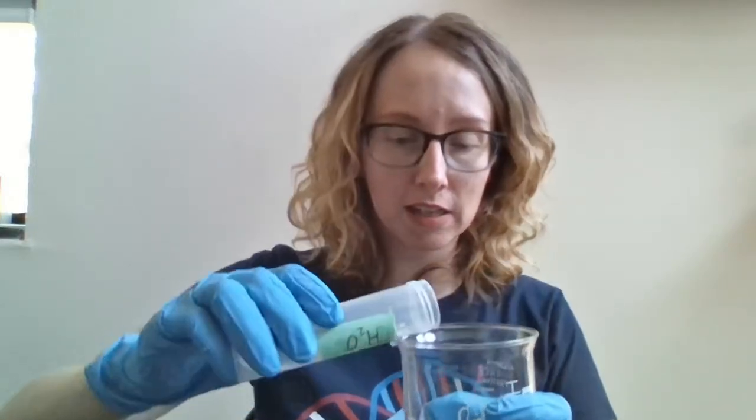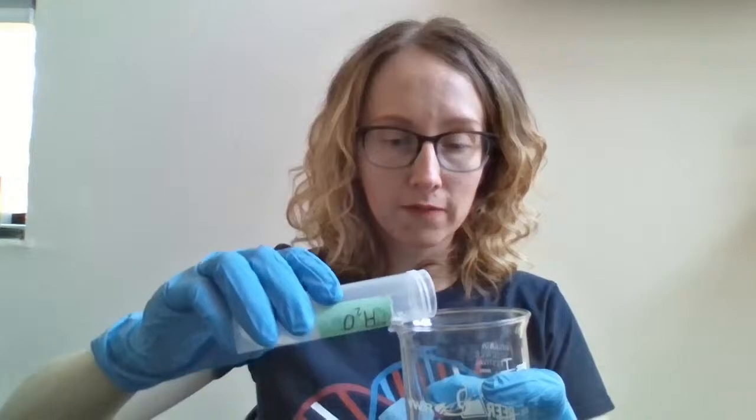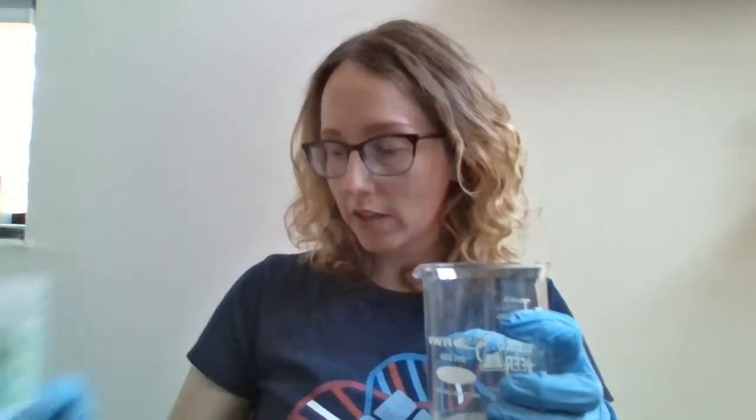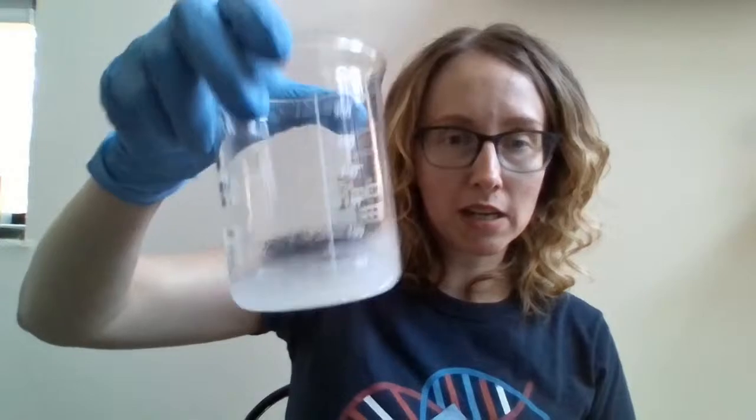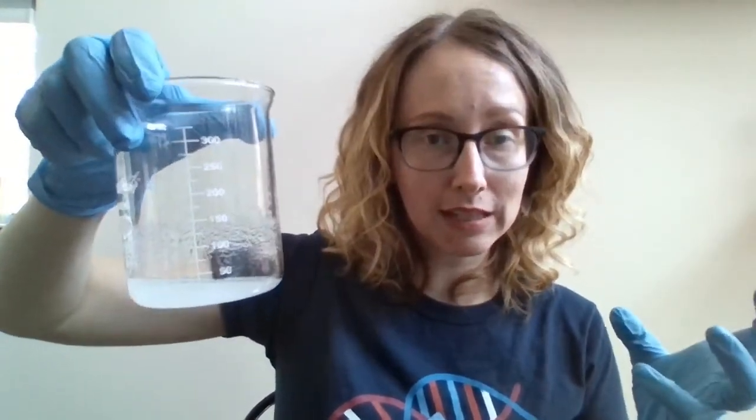There we go. So that looks about right, and you can see the tab immediately starts to dissolve and break up. That's good. The ultimate goal is to dissolve all of the agarose crystals. Now we're ultimately going to need heat to break them up completely. If you were in my kitchen with me, you could look over my shoulder while I did this in a microwave or on my stovetop, but we're not in my kitchen. So I'm going to do this cooking show style. I actually already did this just before we started the webinar. I melted down another agarose tab over heat, and here it is. So this has been kept warm on my bench.